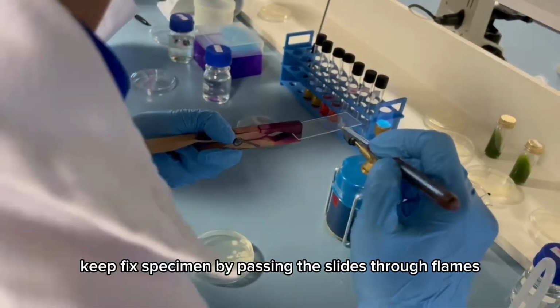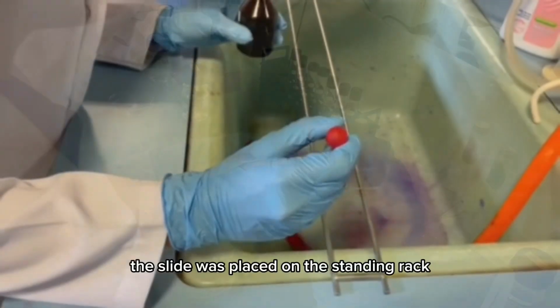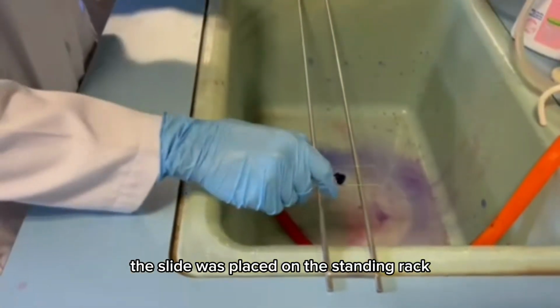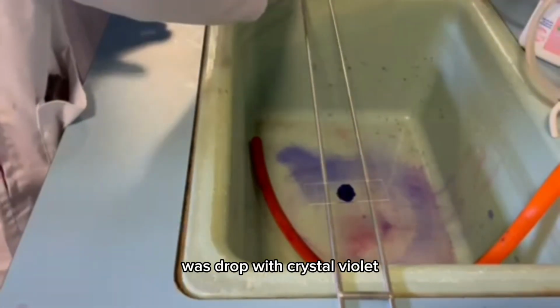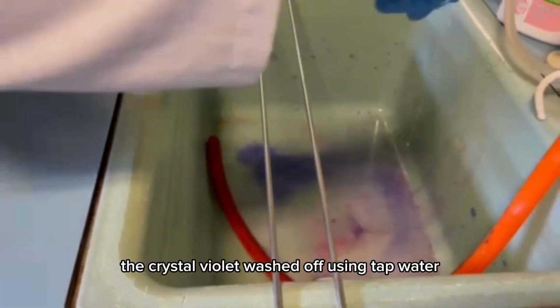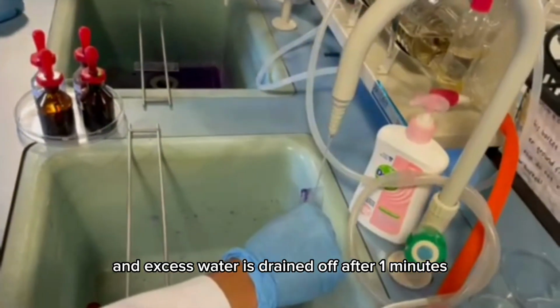Heat fix the specimen by passing the slides through flames a few times. The slide was placed on the staining rack and each smear was dropped with crystal violet. The crystal violet was washed off using tap water and excess water is drained off after 1 minute.